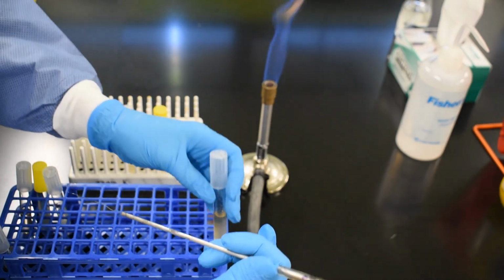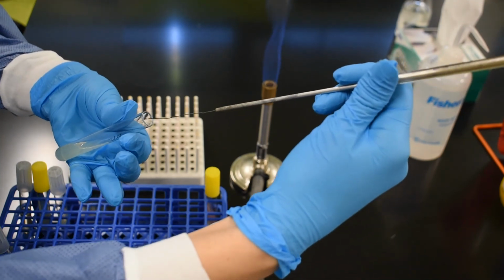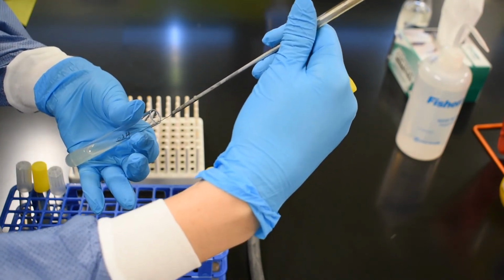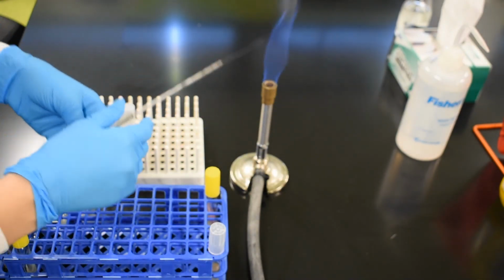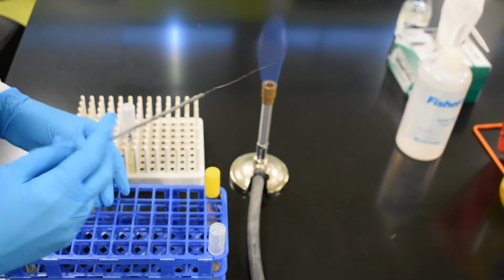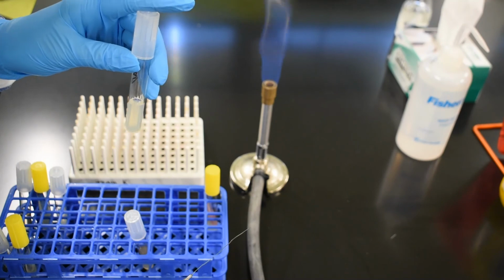We dip the needle into our broth stock tube to coat it with microbes. And then, to transfer those microbes to the slant, we once again place the needle all the way to the bottom edge of the slant and gently spread it over the surface of the slant in a zigzag fashion up to the top. After sterilizing the needle again and allowing it to cool, we have one final inoculation to complete, and that is this final Agar deep tube.